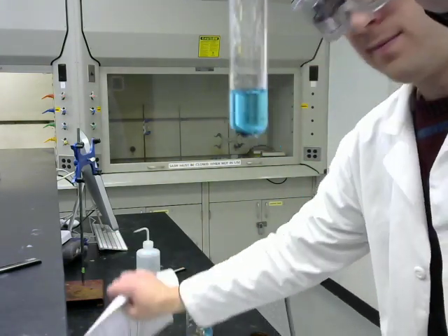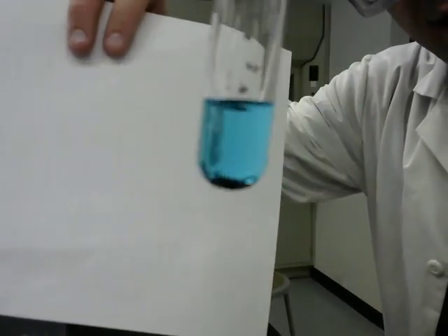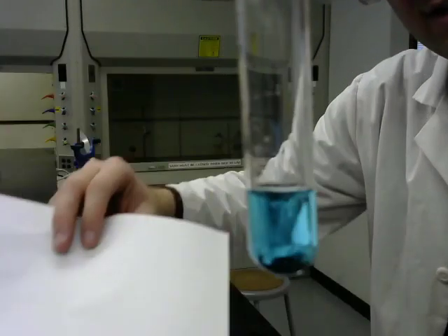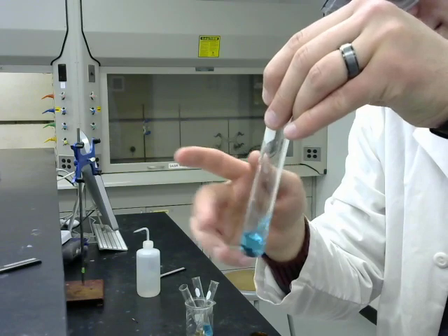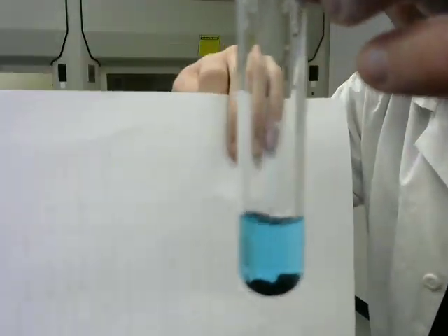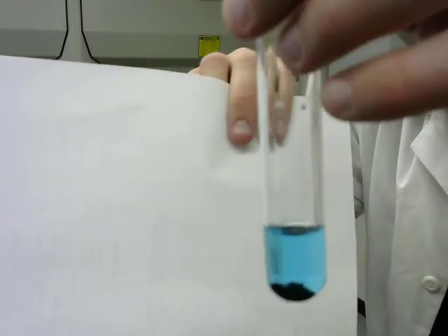And this will take a minute. You can see the zinc on the bottom there. It's already beginning to turn more dark colored. It's black colored instead of the gray that the zinc originally was. I'm going to agitate it a little bit. As I agitate it, it's clearly not a powder anymore. It's aggregating and glomming together.